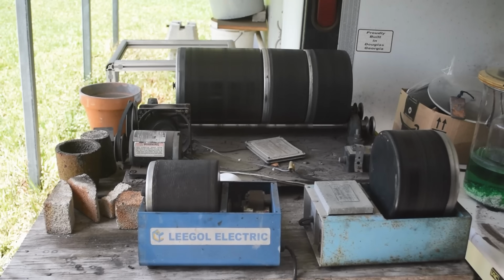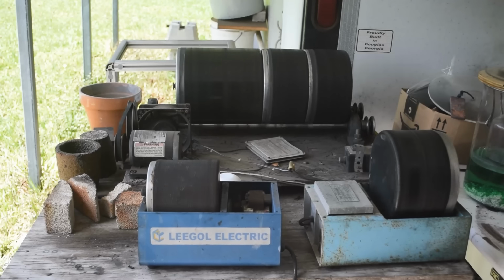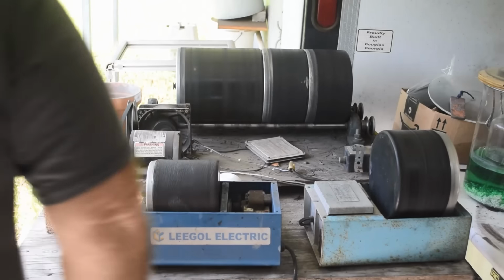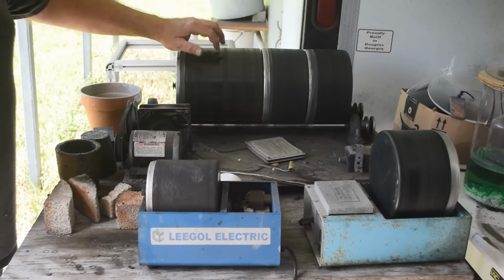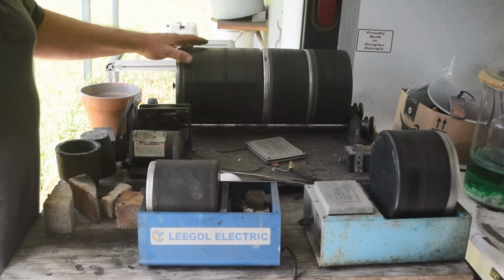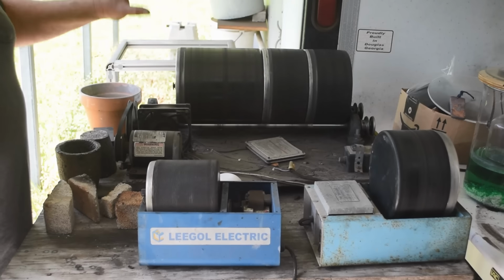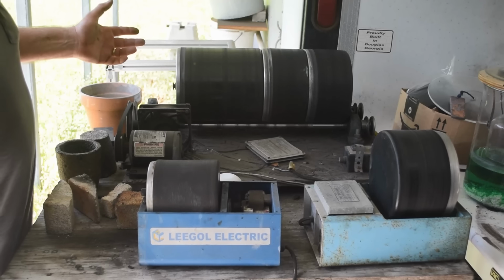Anyway, I have a lot of rock tumblers. These back here are very large. It's hard to tell, probably, just how big they are on video, but with my big hands for scale, that's a 12-pound rock tumbler right there, okay? So my idea is we're going to tumble the pins with the liquid for constant agitation for a given period of time and see how much time it takes.